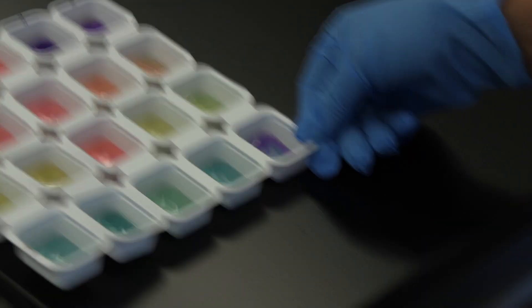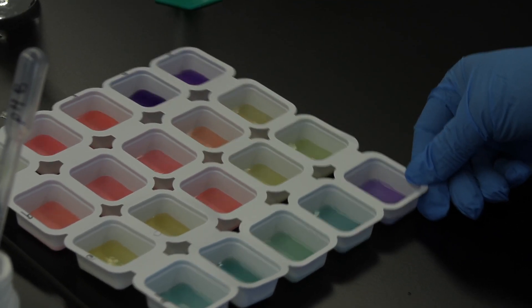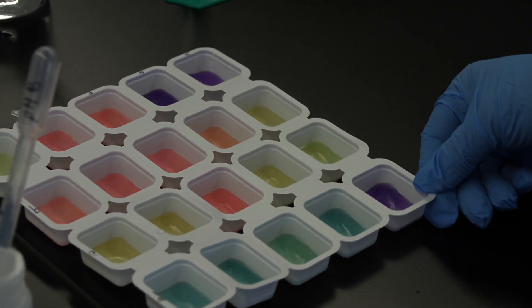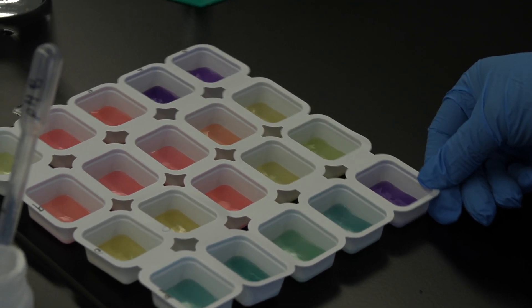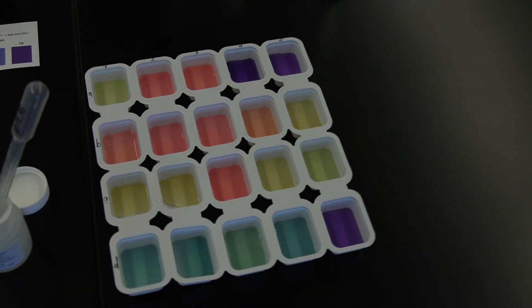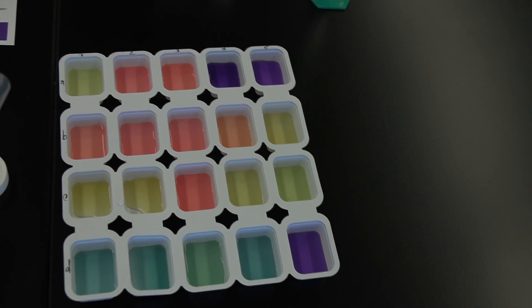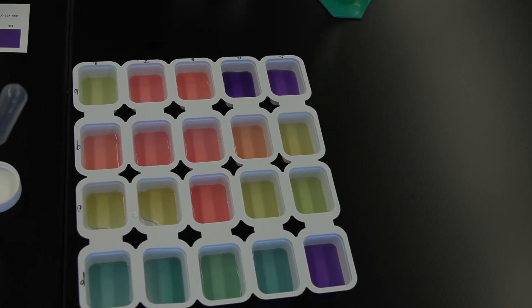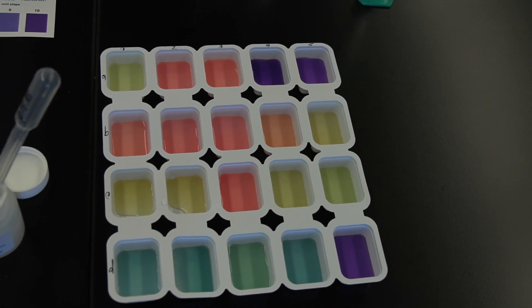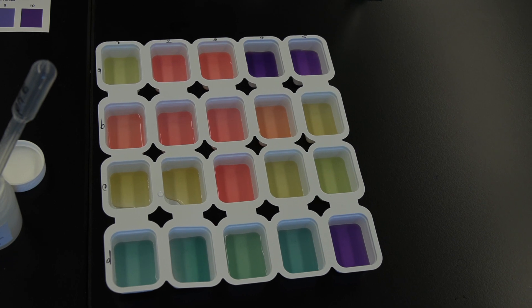Empty and rinse the tray. Make sure the buffer solutions are sealed. Save the water, hydrochloric acid, and sodium hydroxide solutions, and the dropper pipettes for use in the next activity.